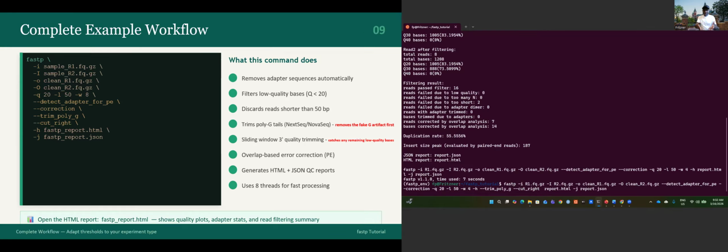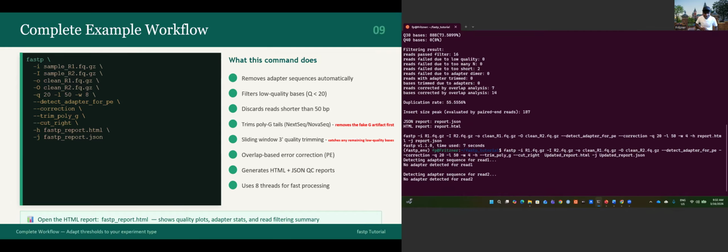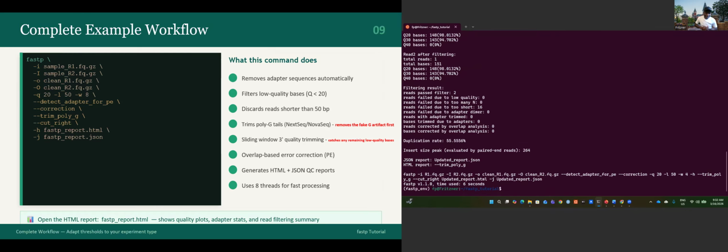So if you run that, it will overwrite the first report that you generated. But if you want to generate another report, you can just rename the report. Let's call it updated report, and the same for the other. It's just up to you. If you want to compare both of them, you just change the report name. I think it should work. Let's see, cross fingers. Yes, it did work.